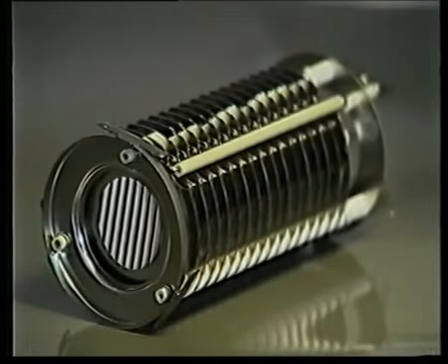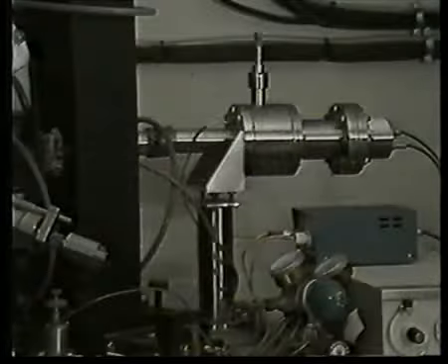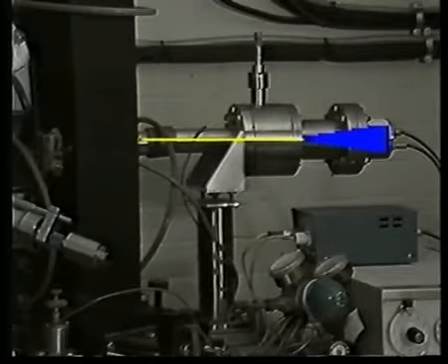The small numbers of ions hitting the first dynode at the front end of the detector eject secondary electrons. Each of these electrons ejects many further secondary electrons at the next dynode. Hence, an ever-increasing number of electrons are ejected at each of the 17 dynodes. The resulting avalanche of electrons, shown here in blue, amplifies the signal by a factor of about 1,000,000 before it's passed on to the display unit.